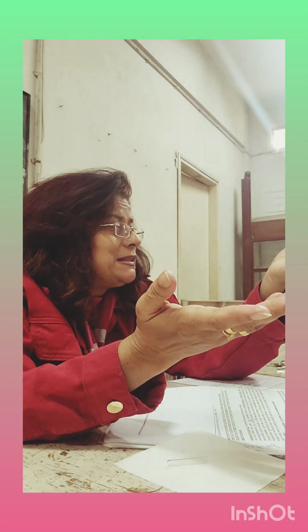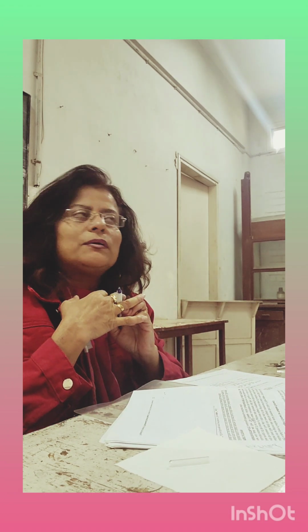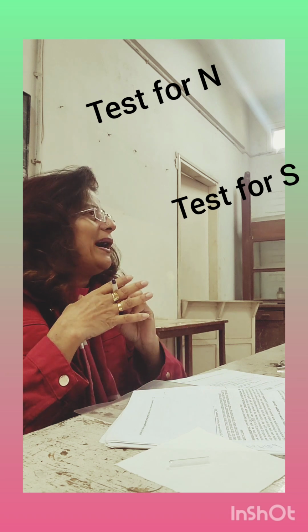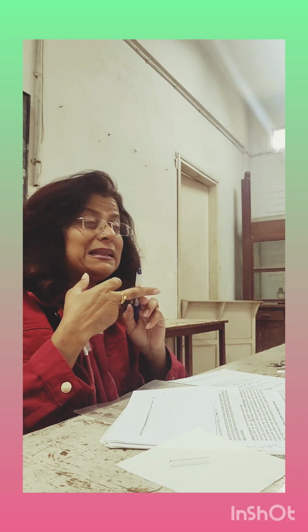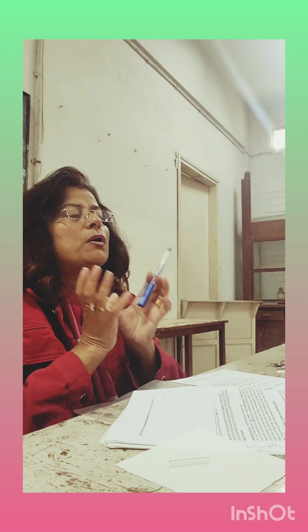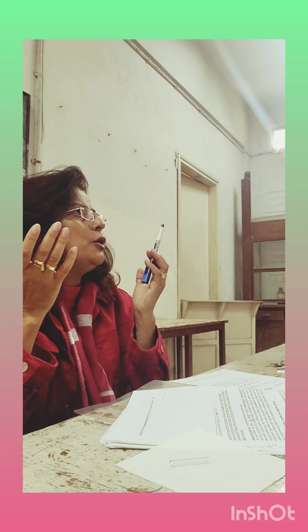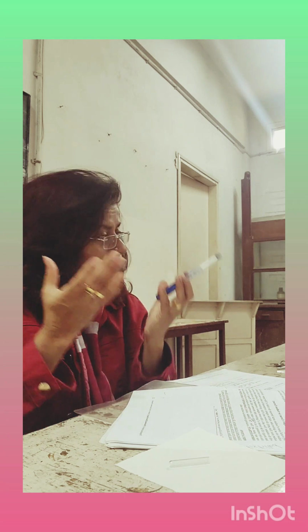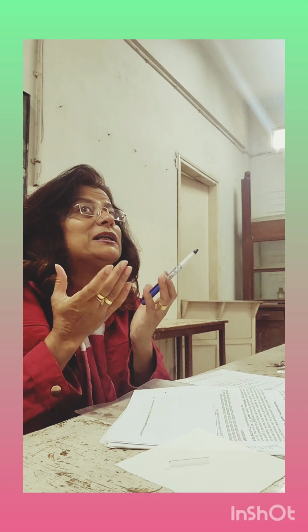And how will we detect them? We will first prepare the sodium extract, and then we will go through 3 tests: the test for nitrogen, the test for sulfur, and the test for halogens. In the test for nitrogen, you are going to detect whether your compound contains nitrogen or not. Though you know that it has nitrogen in it, you need to confirm it practically, by going through the experimental process.